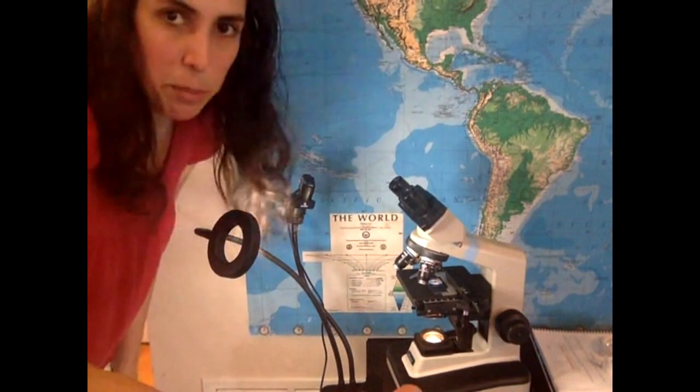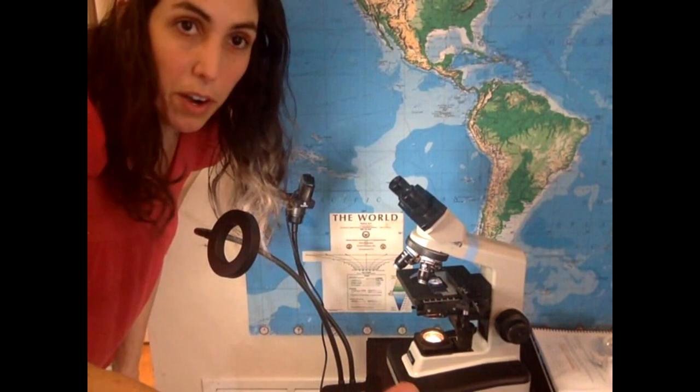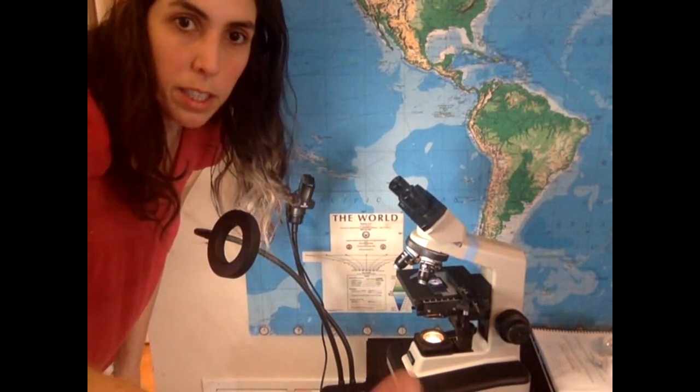And if I could keep this stable enough, I wanted to show you what I see from the beginning, but that's very challenging. Okay, let's see. Come on, let's see. See, and then when I look at it, I'm like, is that on my sample? Then I move, see how my sample moves? Then I know that this is actually my sample that I put on this slide.